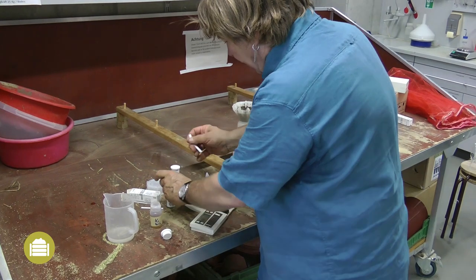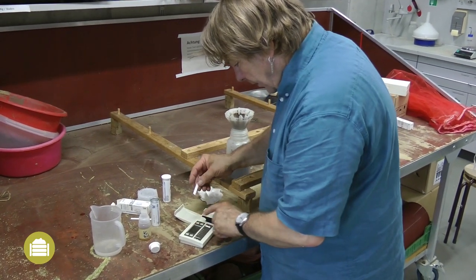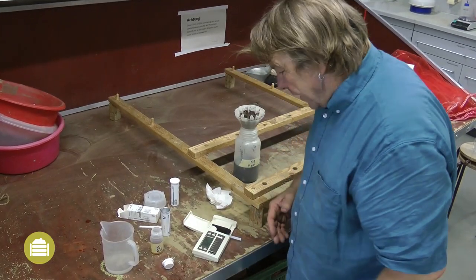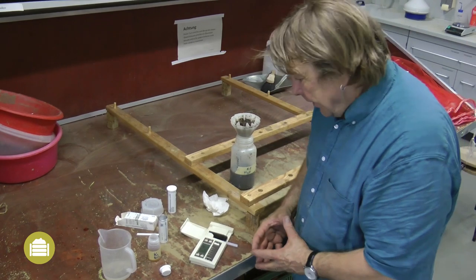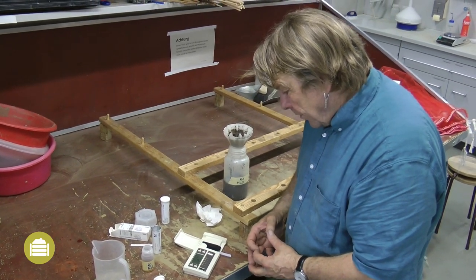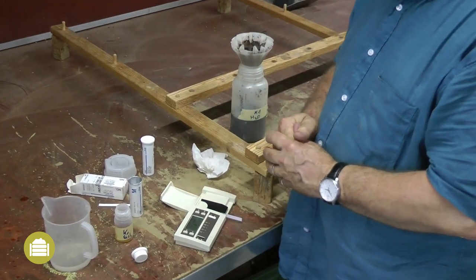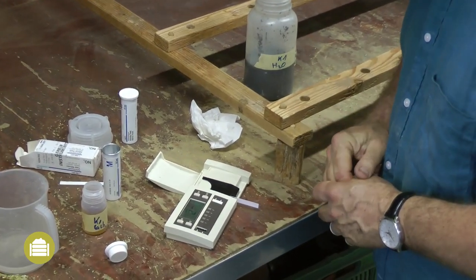The analysis of nitrate is slightly longer — it needs 60 seconds. In a few seconds I will know how much nitrate is in the extract. This value can be used to calculate the nitrate content of one kilogram of compost dry matter.